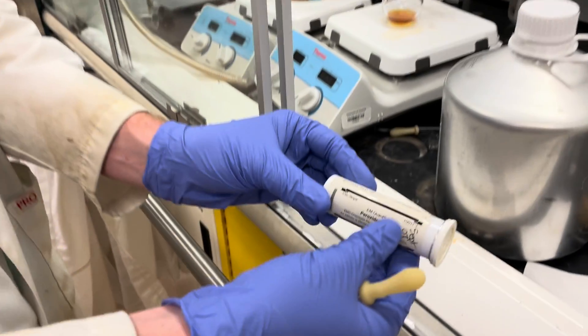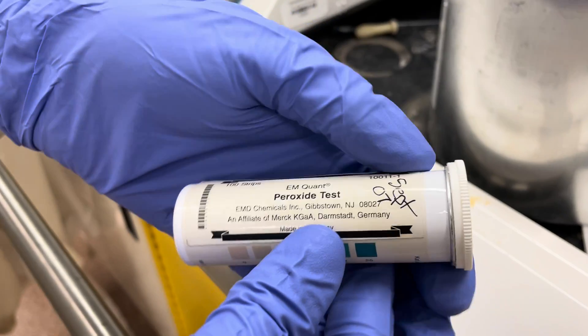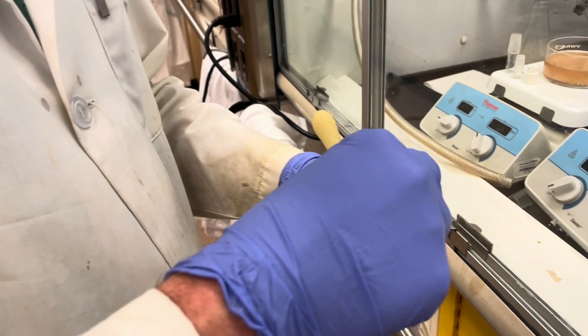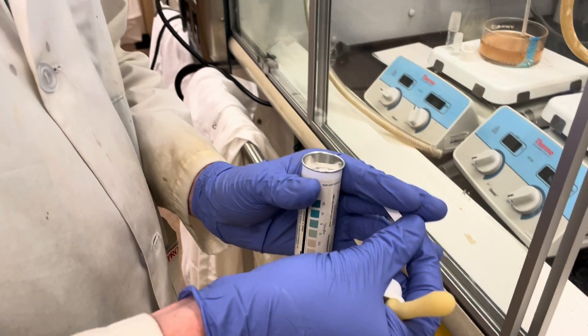So we use these test strips. These are supposed to be kept in the fridge. They do go bad if they're warm so I would recommend that you keep yours in there as well.